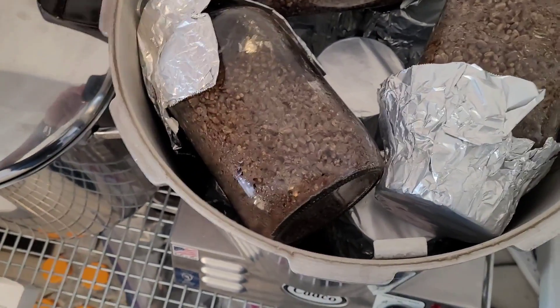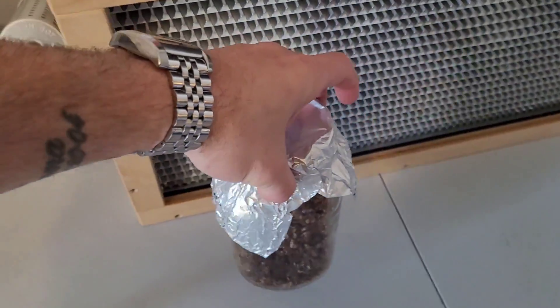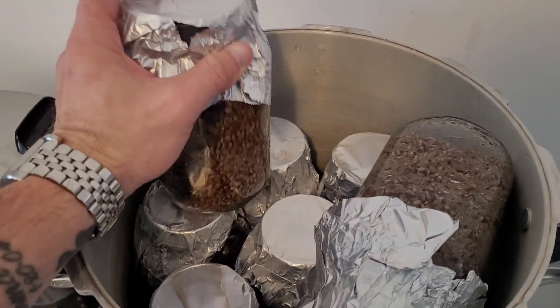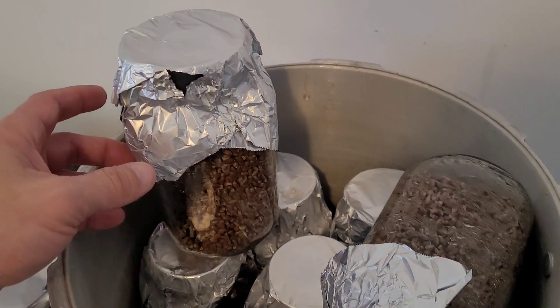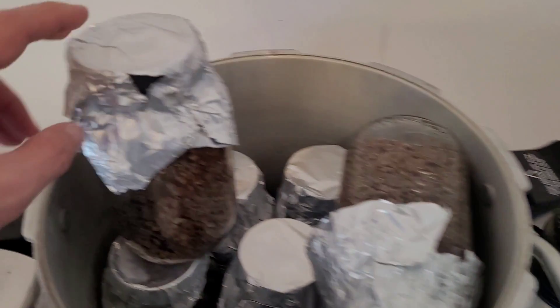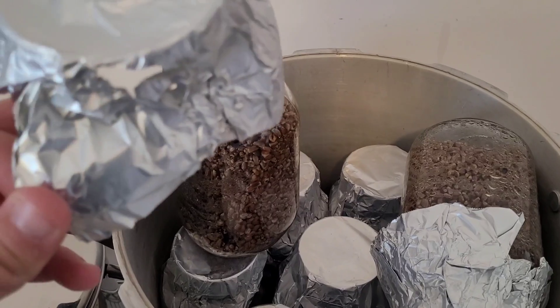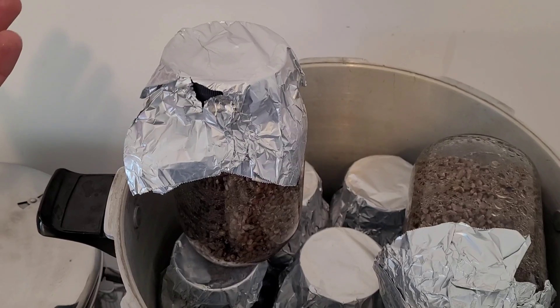If you're going to be working on these, grab them by the foil cap and place them in front of your flow hood or in your still air box, whichever one you use. If you're not planning on inoculating these immediately, there's really no need to use the foil cap because they're just going to be put on a shelf. Never put your grain jars on a shelf with the foil lid on — it will just trap moisture between the foil and your filter and you could get contamination issues like mold.